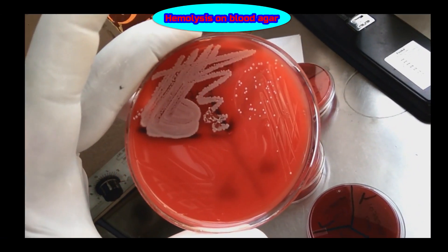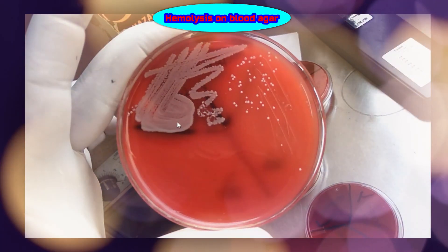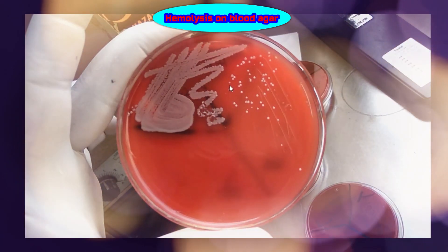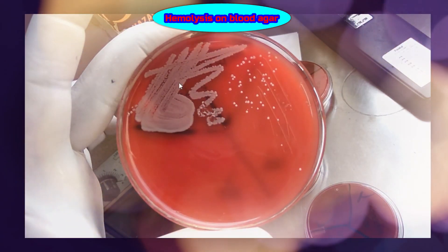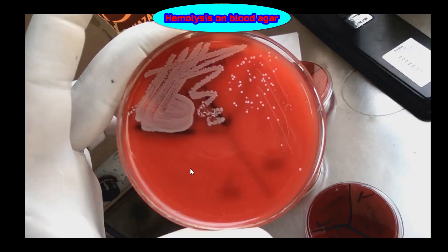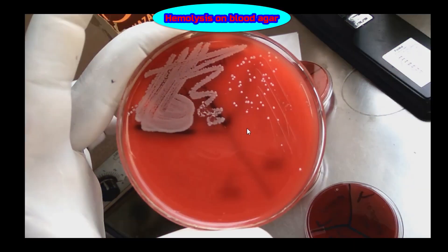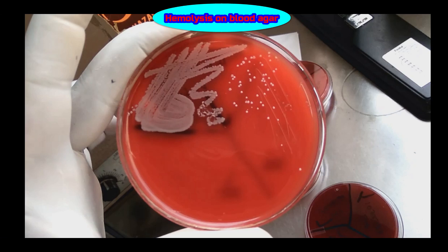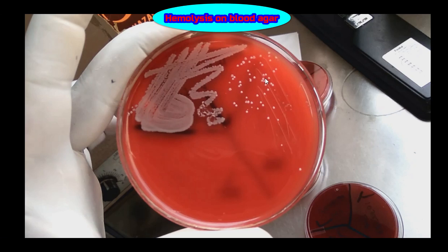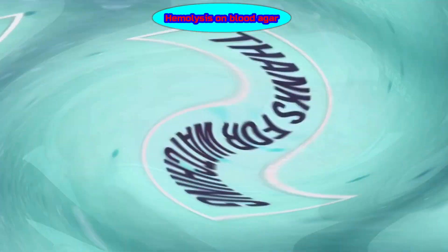In this way we can see whether an organism is alpha hemolytic, beta hemolytic, or gamma hemolytic using blood agar. I hope this clip will be helpful.